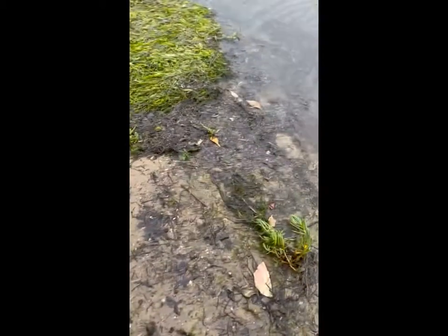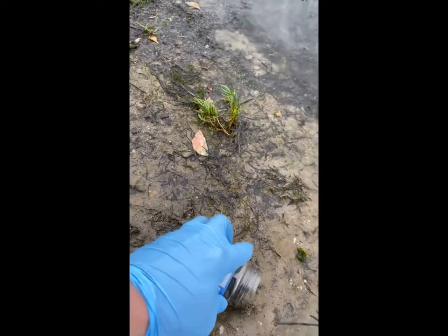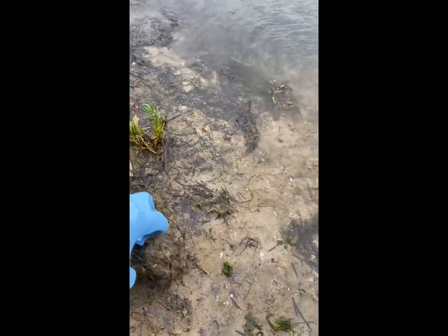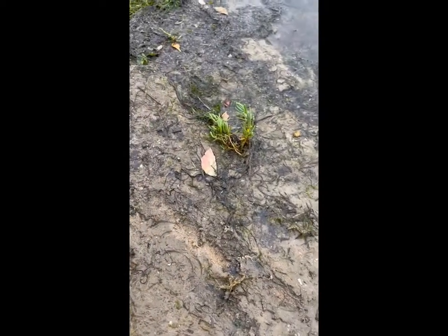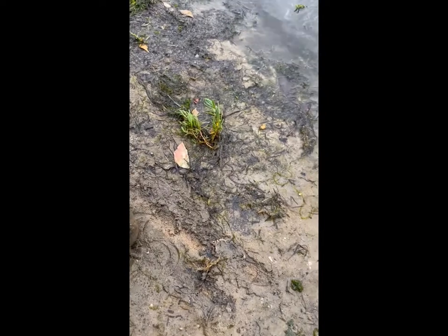To collect sediments, simply use the bottom lip of the jar as a scoop to collect the top two centimetres of flood deposited sediment from river edges. Recently deposited sediments are more likely to have pollutants from the floods that may pose risk to humans and animals. Try to avoid scooping any gravel or leaves or other coarse organic debris into the jars. Remember, don't touch the inside of the jar and don't touch sediment with your gloves, just use the edge of the glass jar.